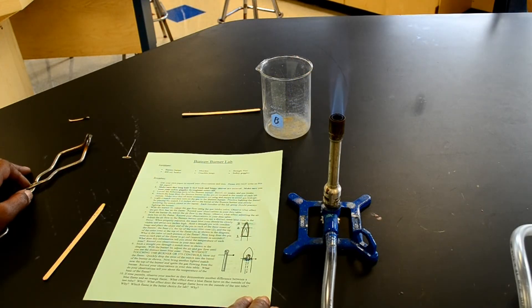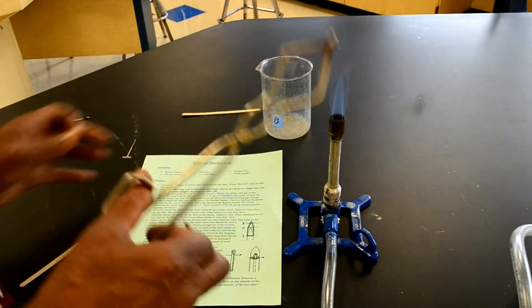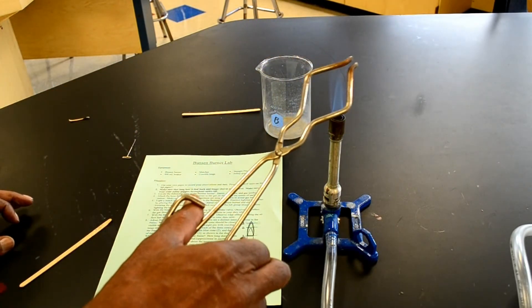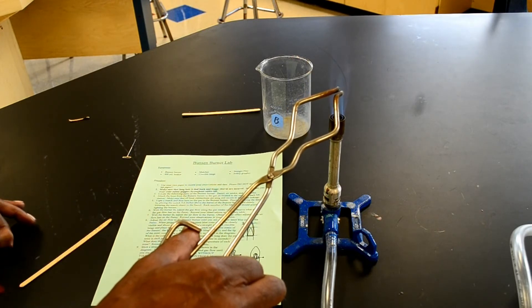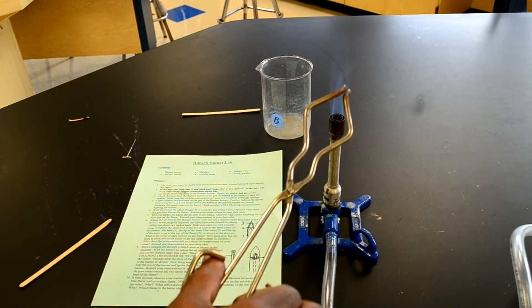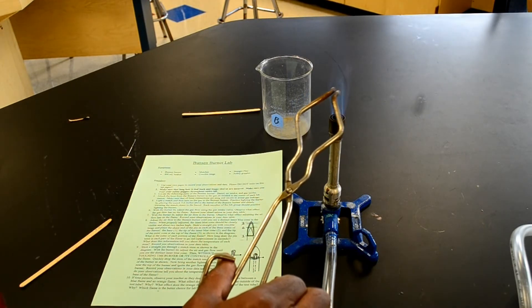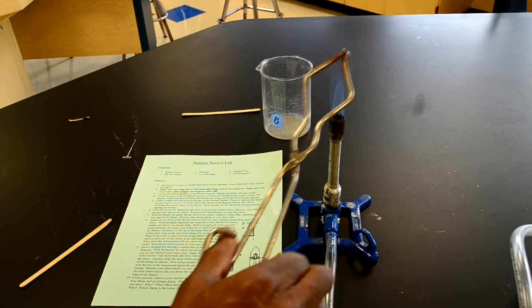What is the color of each portion of the flame? That's barely visible blue, right? But the inner cone is a heavy blue. We can see it's really blue right there. We can actually call that sky blue. But this up here is blue, but it's hardly visible.